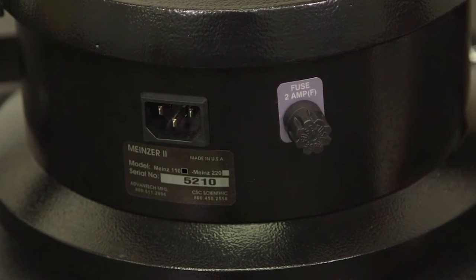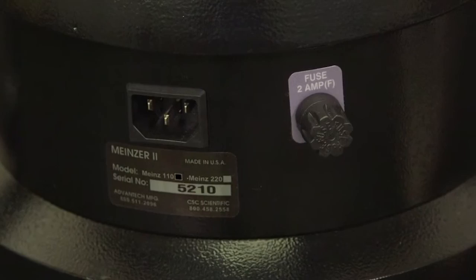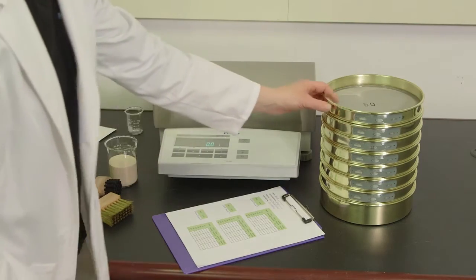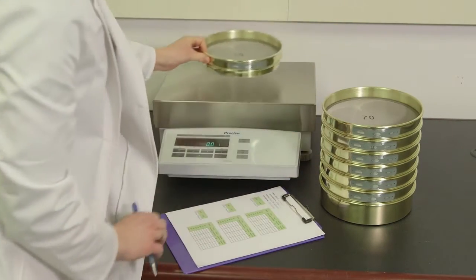Verify that your power configuration is compatible with the rating label on the back of the shaker. To run a test, prepare your test sample per your industry's standards.